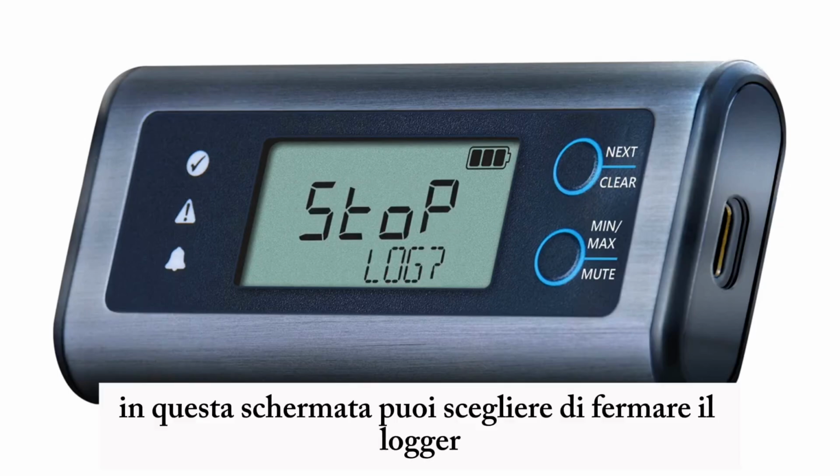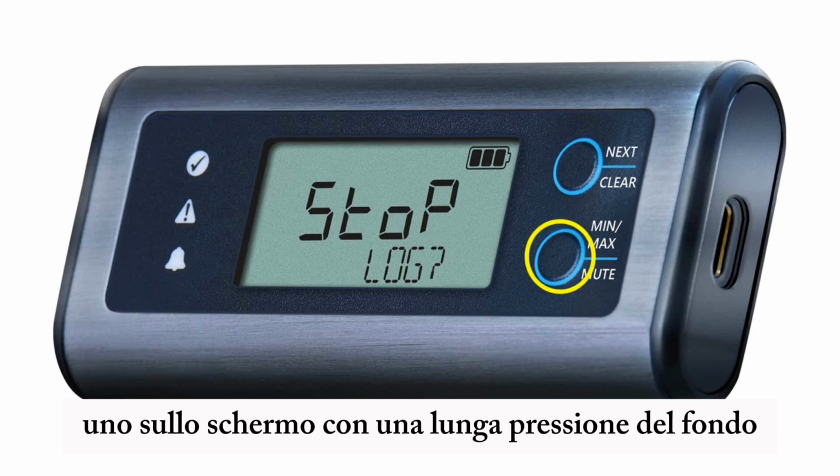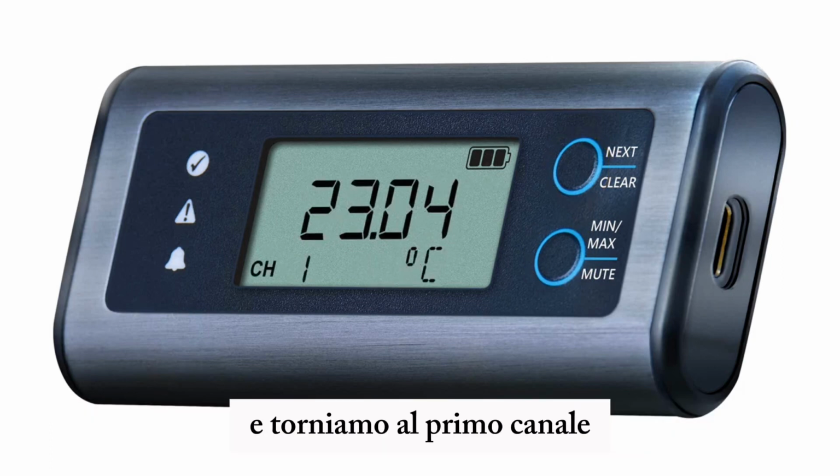In this screen you can choose to stop the logger, which you can do if you want to while on the screen with a long press of the bottom button. Otherwise we press the top button again and we're back to the first channel.